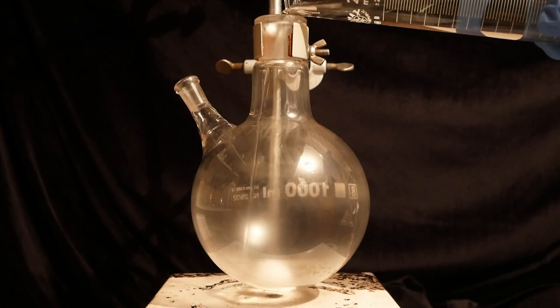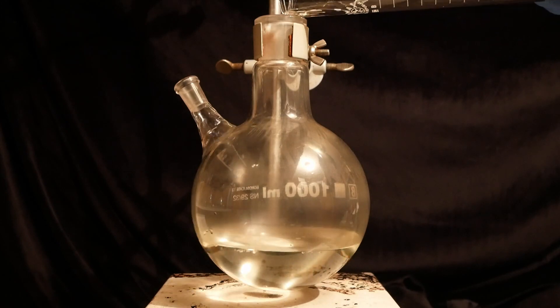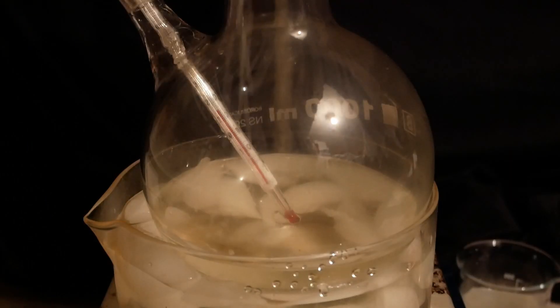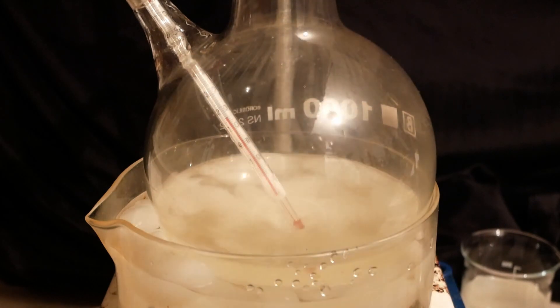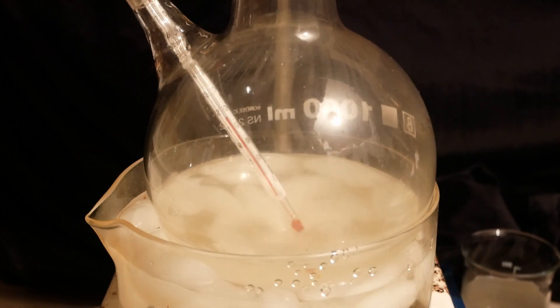But now that I know the actual concentration of the hypochlorite, I can do a third run. So I once again measured out 200 mL of the hypochlorite and dissolved 20 grams of sodium hydroxide in the solution. Also this time, there's no precipitation. The concentration of the hypochlorite is effectively half of what I expected, so I'm using half of the hydroxide and benzamide. Also I kind of ran out of benzamide since I used most of it up during the previous runs.